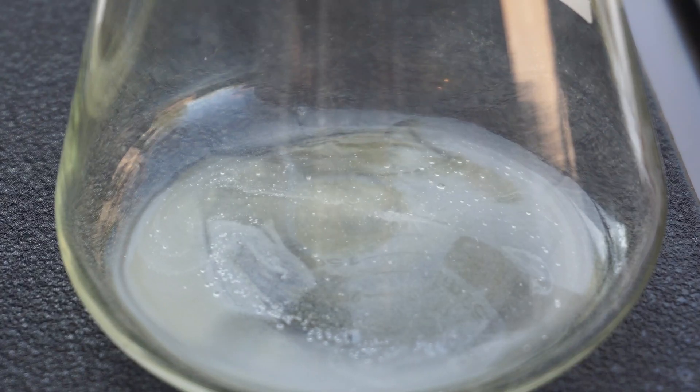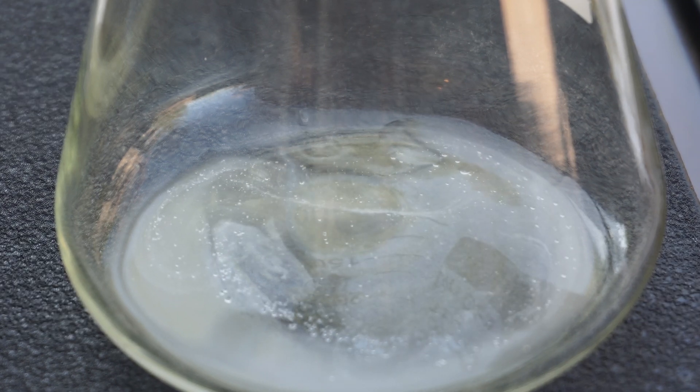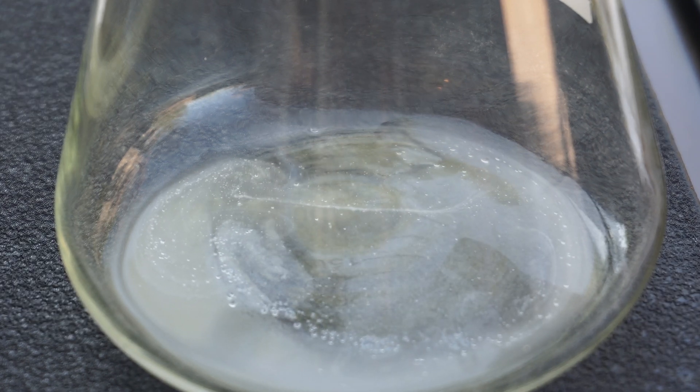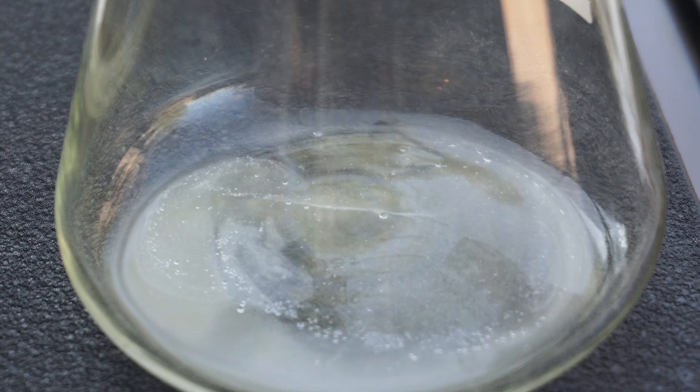We can actually see in our receiving flask that the oil has started to come together to form bubbles on the surface of the water. This is just some of the oil within the solution though.